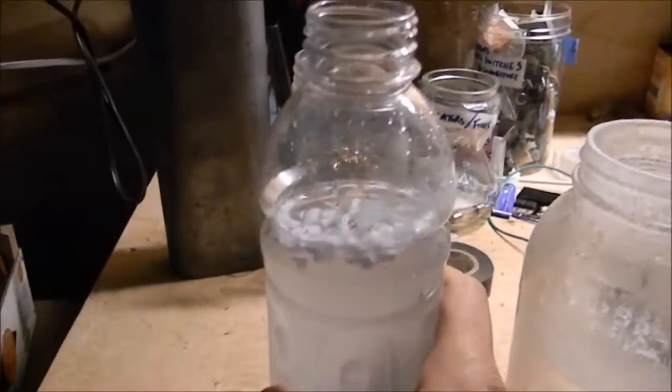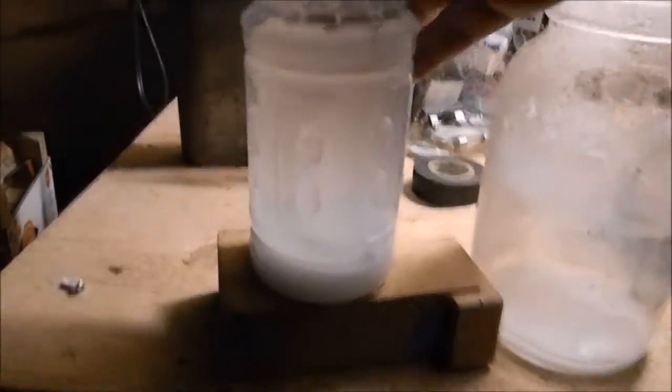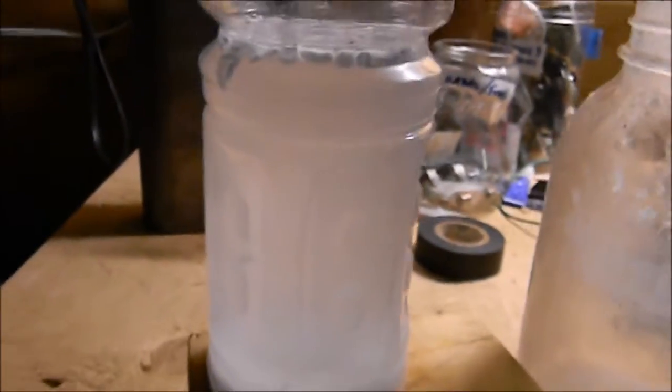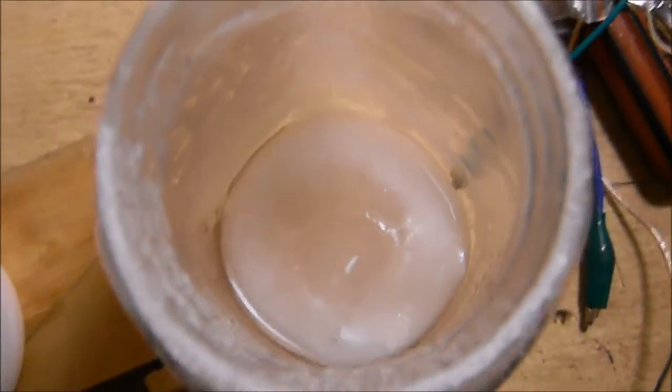In the end, I have this solution in a vitamin water bottle. There's this white precipitate - I think that's lithium hydroxide precipitate and the solution is just too saturated. I got to get a pH tester and test it. Also in my jar that I was doing the reaction, there's more of this white goop.